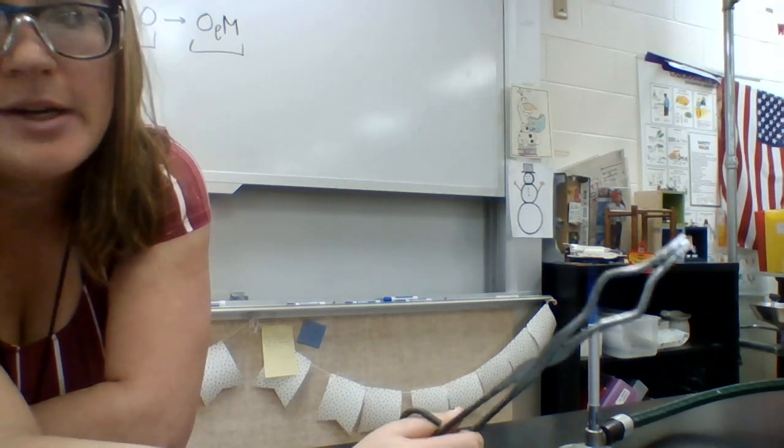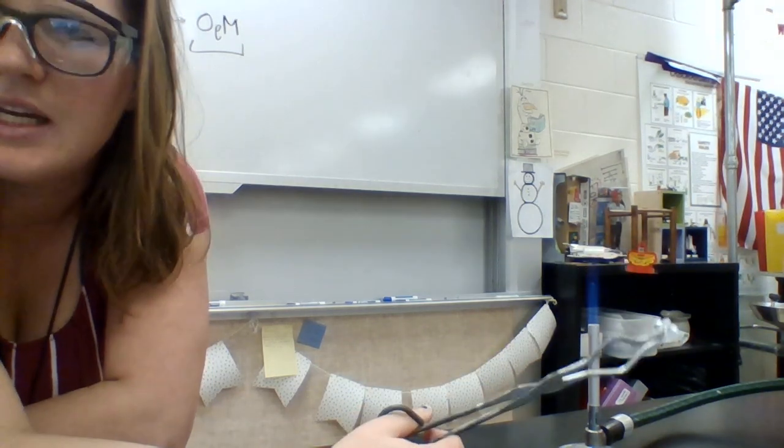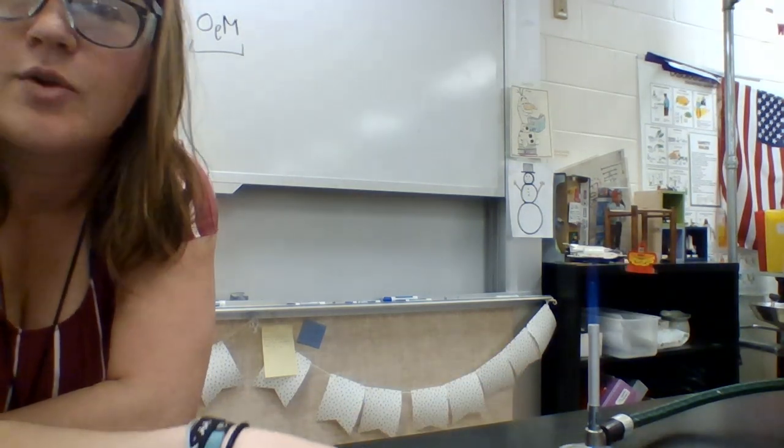Evidence that a reaction was happening. You're going to have to come up with that on your own, but think about exothermic versus endothermic. What did we see? What did we notice? All right. If you have questions, let me know.